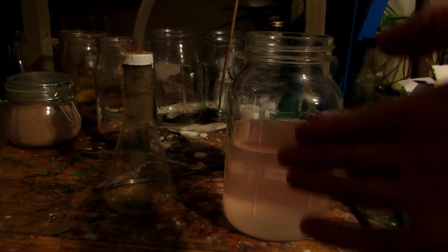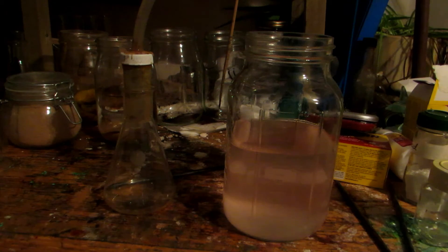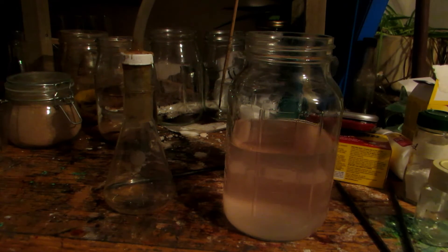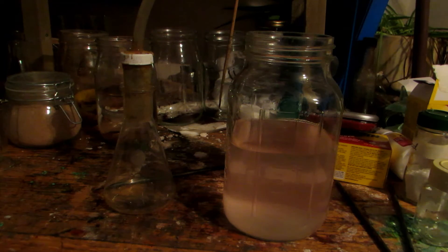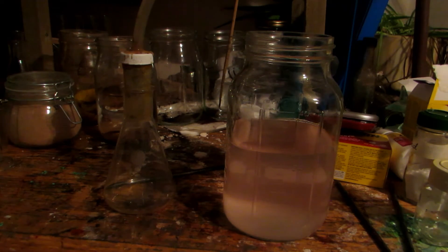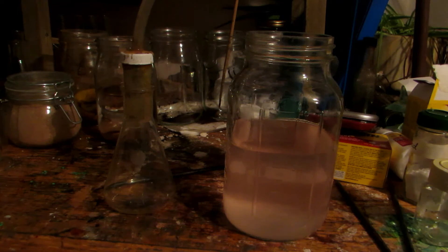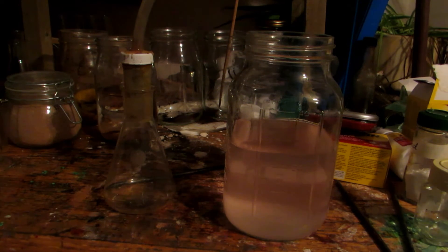The solution is slightly pink, but everything seems to be dissolved. We filtered off all the remaining solids and discarded them since they're useless to us. You could wash the filter cake with a bit of extra methanol, but it wouldn't yield a huge amount more.